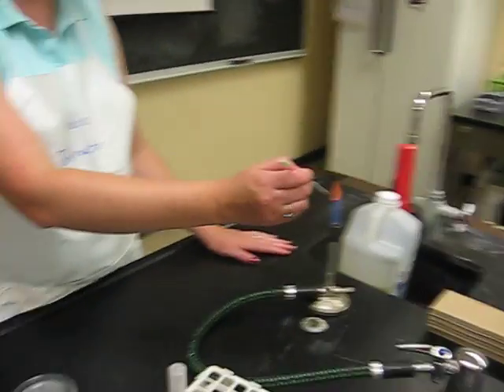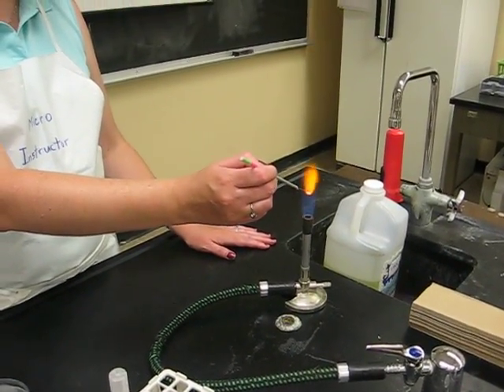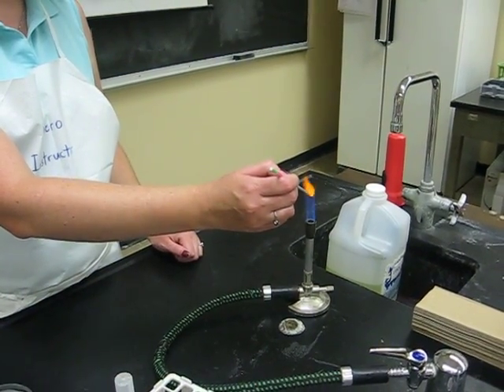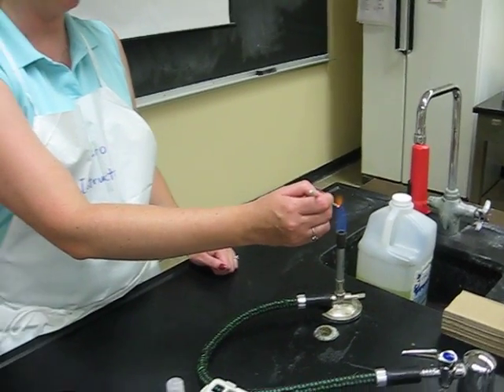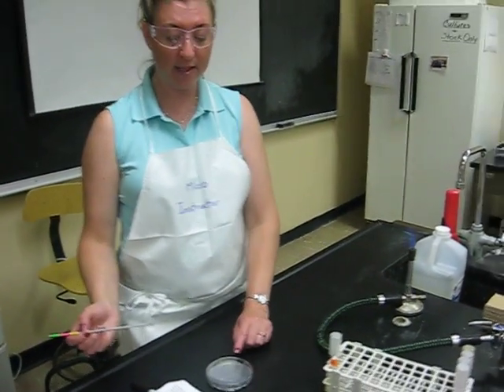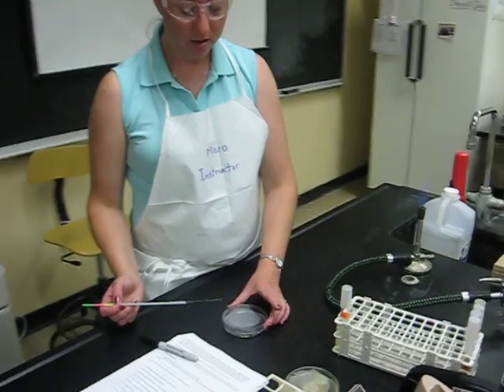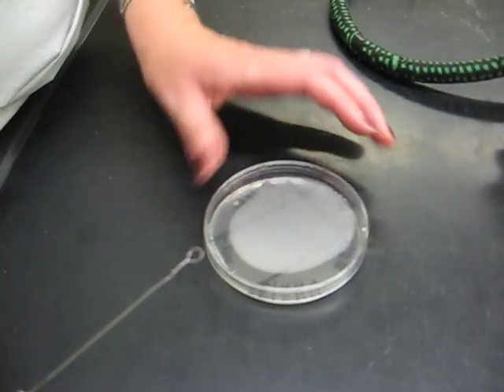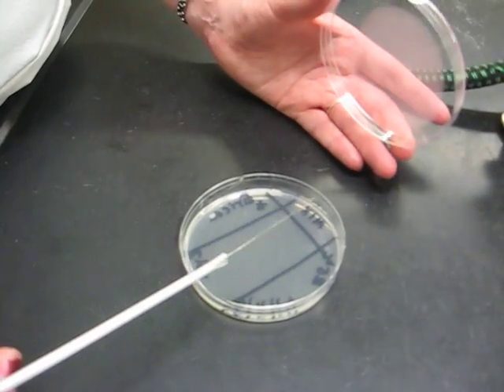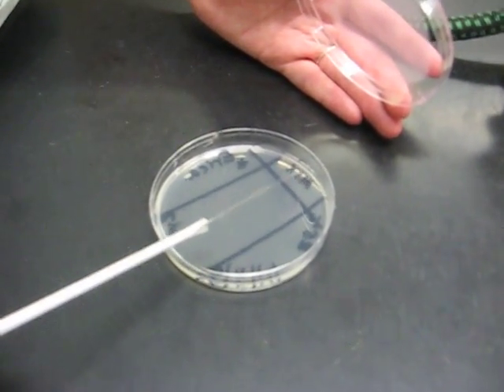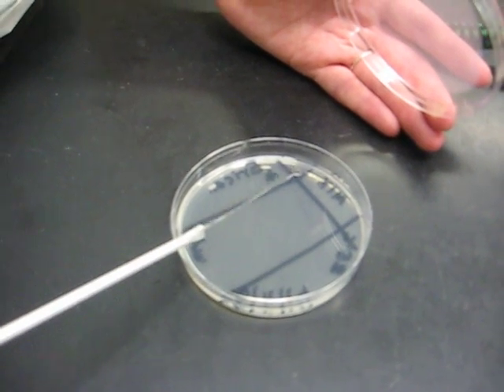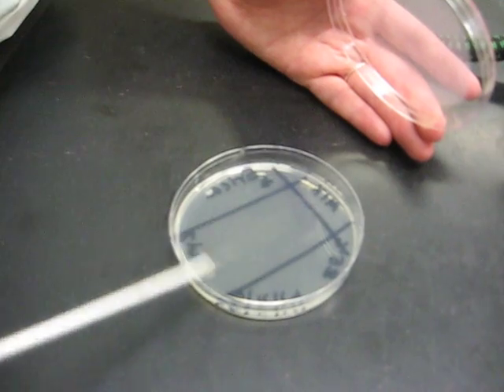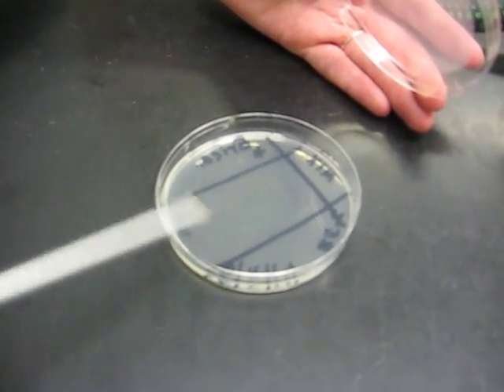The purpose of this is to kill all the bacteria on this loop. Again, don't go back to the culture. This technique is to spread the bacteria out on the surface of the agar so that hopefully they're all by themselves when they grow. So now I did it at the top of this plate, so now I'm going to turn it so that now I'm going to go to the top of this section. And as I go from the top over, you'll see I'm crossing over to this little section right here from the first section. So I'm picking up bacteria when I do that. I want to stay in that section.